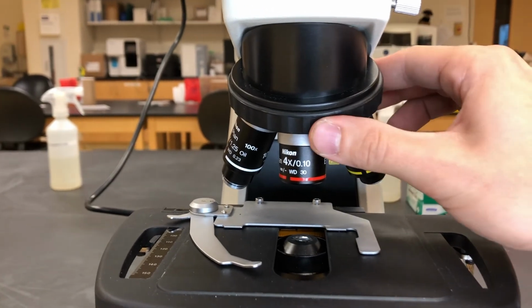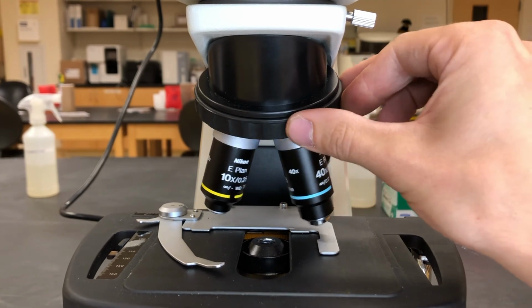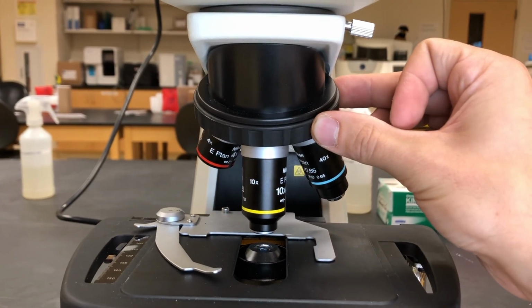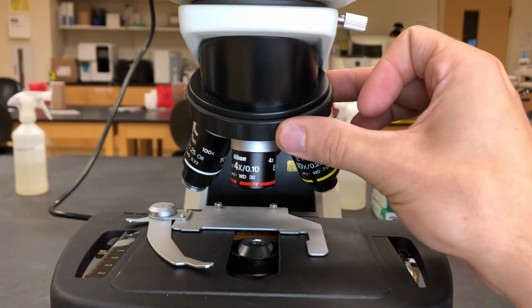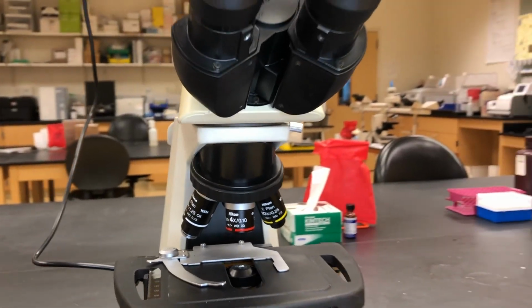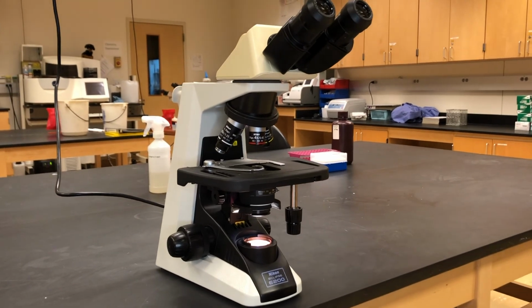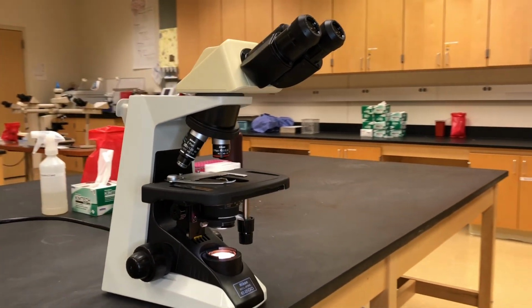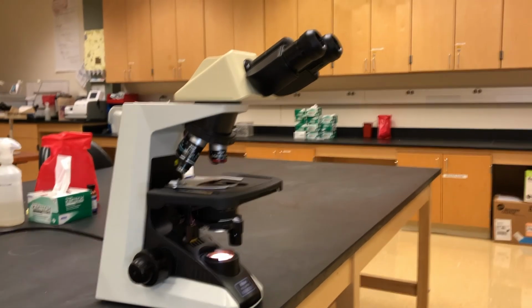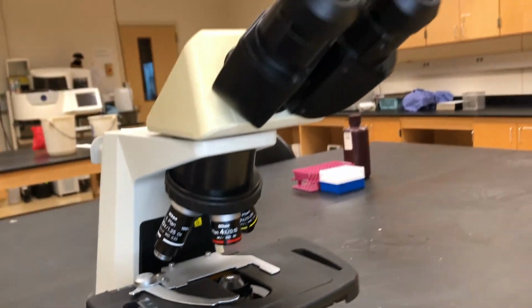Going back to our microscope again, we have our nose piece. Attached to the nose piece are our objective lenses. Notice that when I'm spinning them, I'm actually spinning the nose piece, not pulling on the objective lenses. On this microscope we have a 4, a 10, a 40, and a 100. 4, 10, and 40 are just dry. They don't use any oil, and the 100 times magnification lens uses oil immersion. What that oil does is it's going to increase your resolution. You're going to get real crisp, clear images.